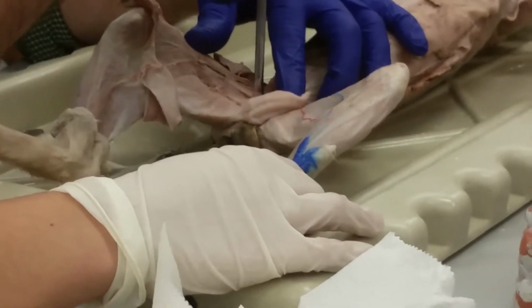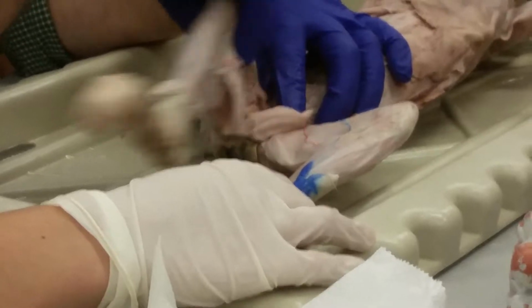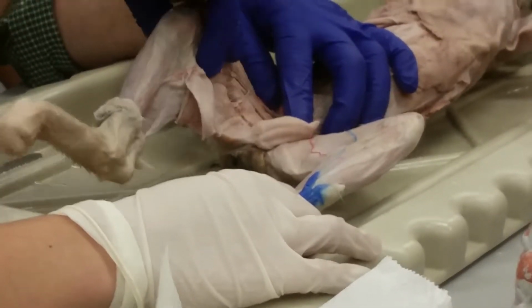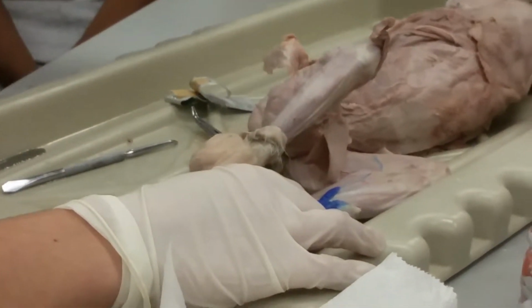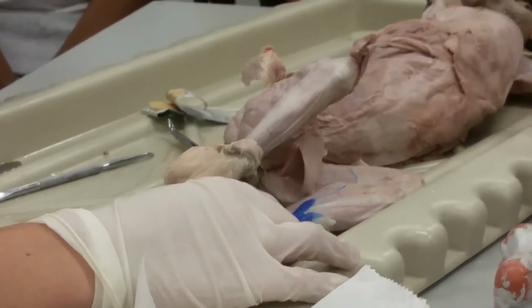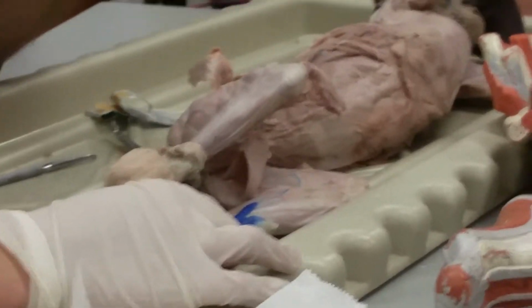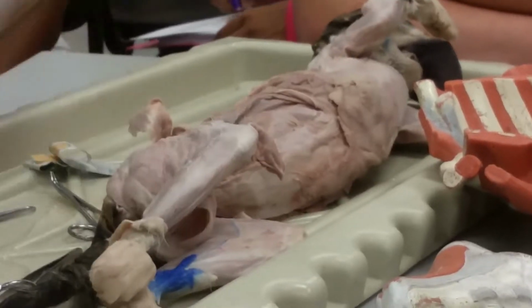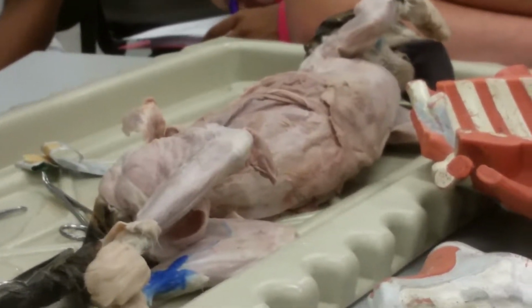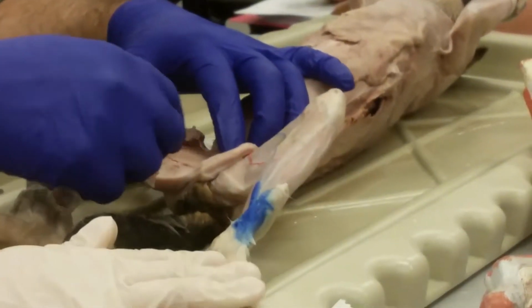You may wonder, why do you need all these adductors? Well, remember what I said, if you pull on a ball and socket, it's going to rotate, right? What if you don't want to rotate? Then you have to have two muscles that wrap around the bone in either direction so that both pull from two sides, and then you can adduct without rotating. If you want to rotate, you can just use one, right? So that's why we often have several muscles coming from different angles, inserting into the femur or the humerus that apparently do the same thing because they'll cancel the rotation of each other. Okay? So that is the adductor. We're only asking you to know the adductor longus.